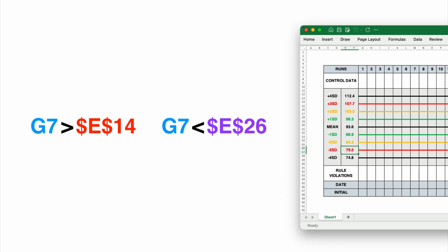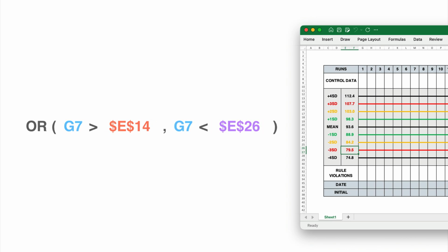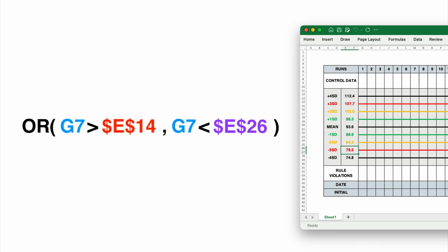Now here's the key. We don't need both conditions. We just need one of them. That's where the OR function comes in. OR asks, is at least one of these statements true? If G7 is above E14 or below E26, the OR function will return true.